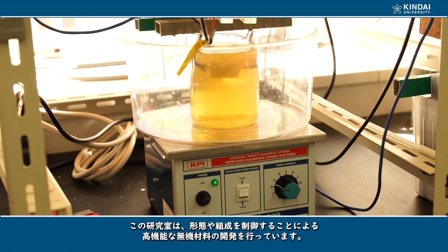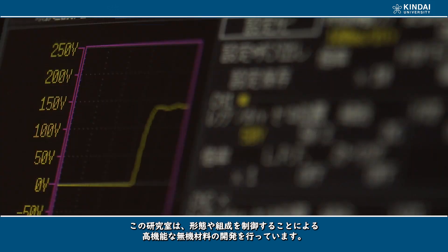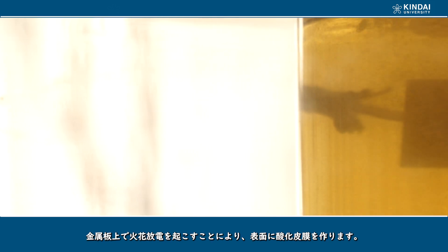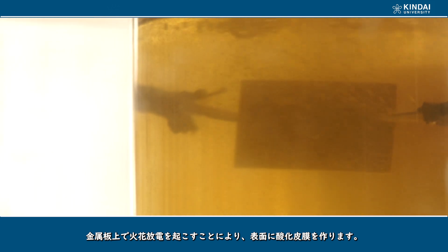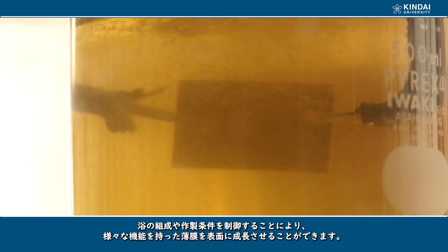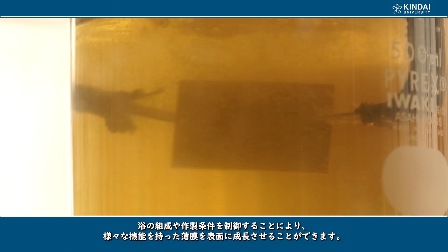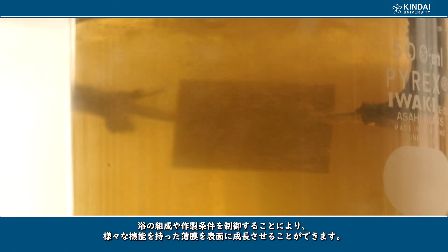Here, we are developing functional inorganic materials by controlling their morphology and composition. A spark discharge on a metal plate creates an oxide film on the surface. By controlling the composition of the baths and fabrication conditions, it is possible to grow thin films that have various functions on the surface.